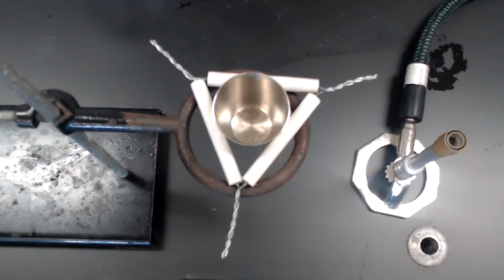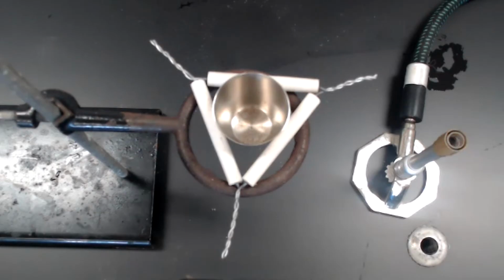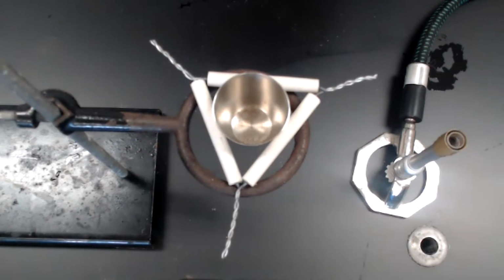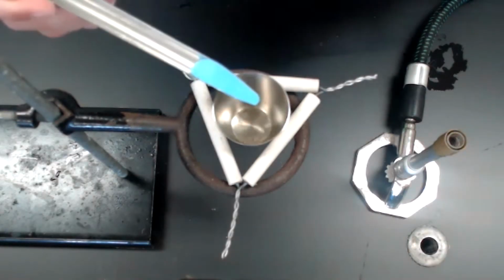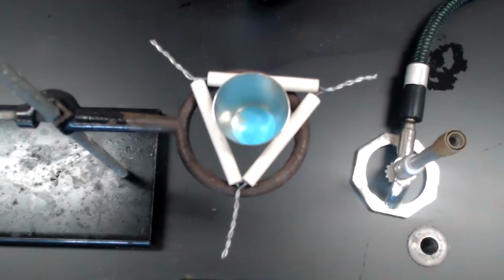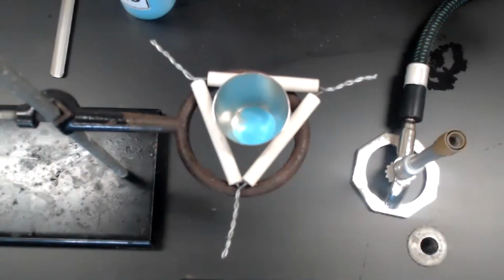In our next experiment, we are going to be adding some cupric sulfate pentahydrate, also known as copper 2 sulfate pentahydrate, to a crucible and heating it. So first I'm going to add some of the solid to the crucible. And now I'm going to heat it using the Bunsen burner as I did earlier.